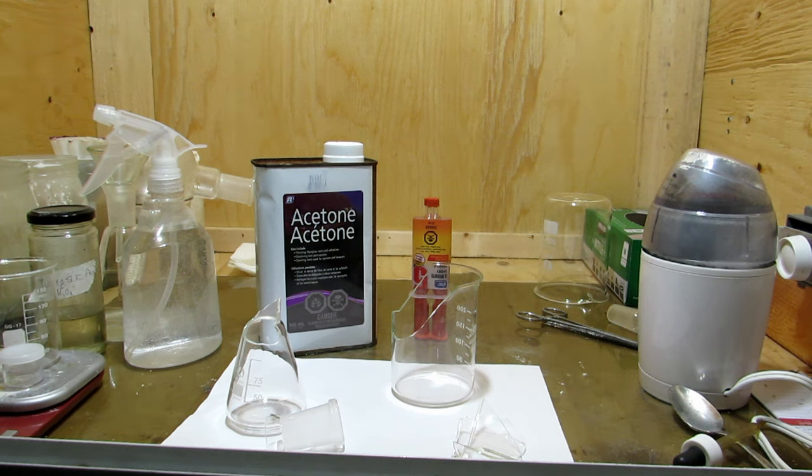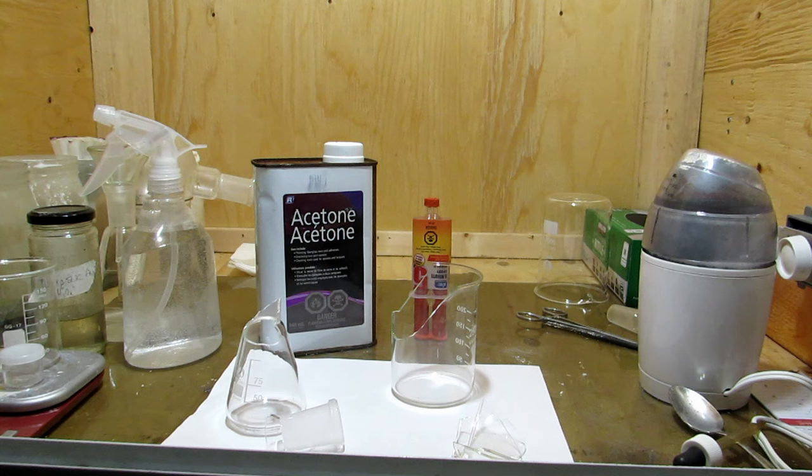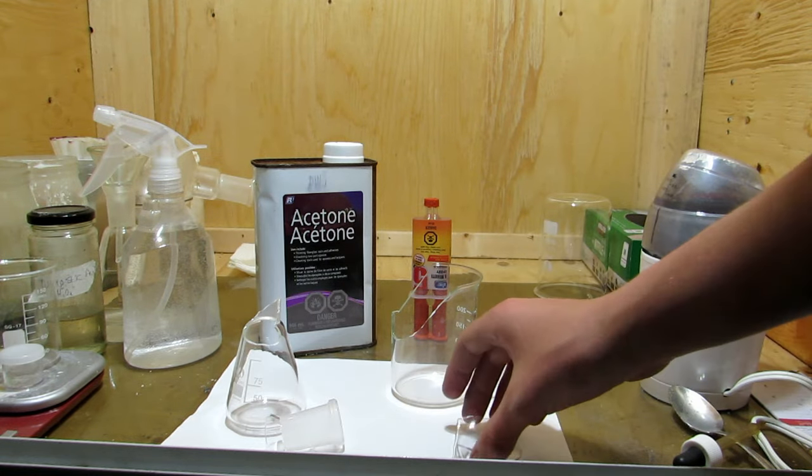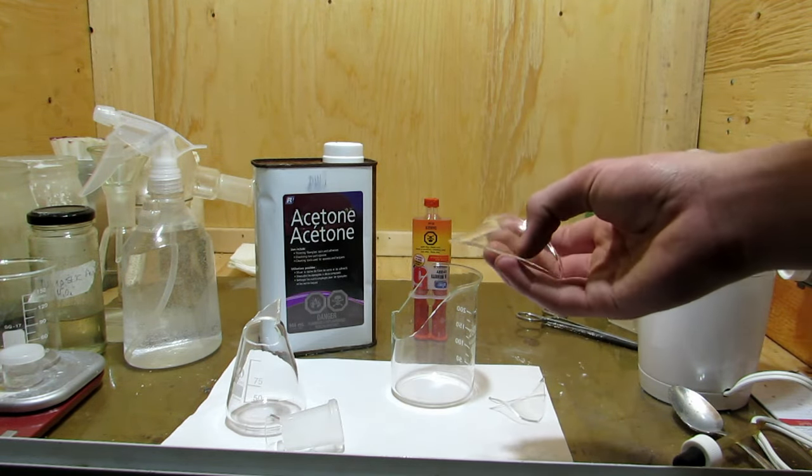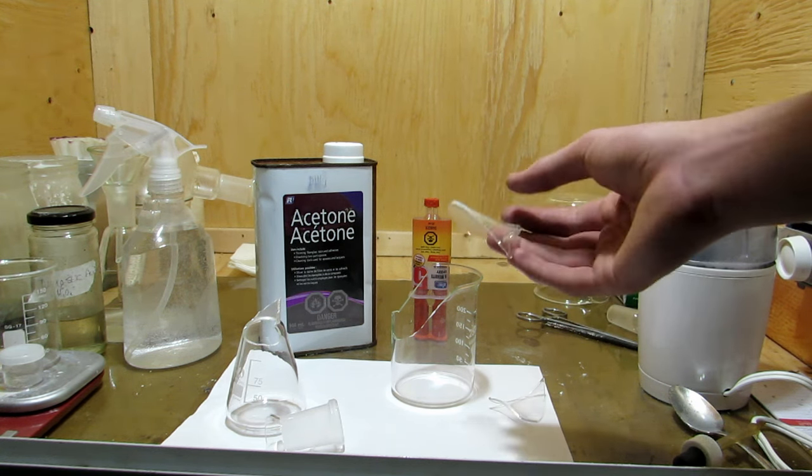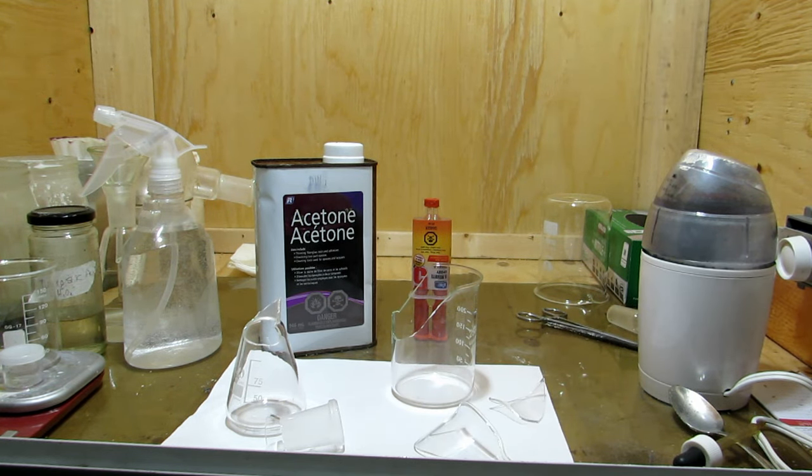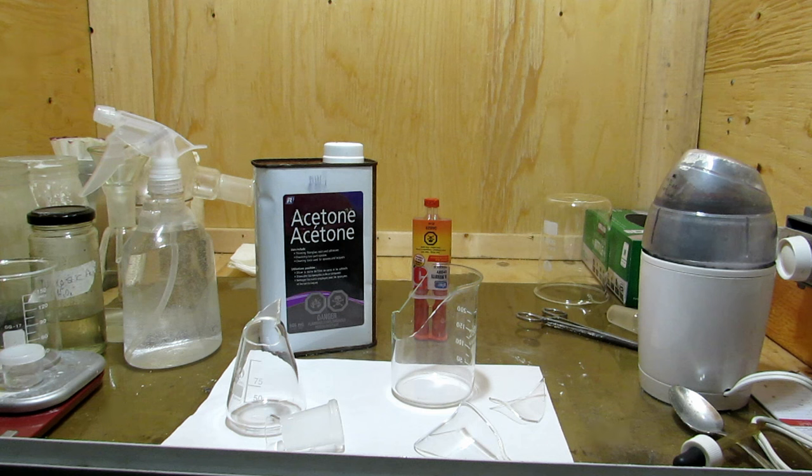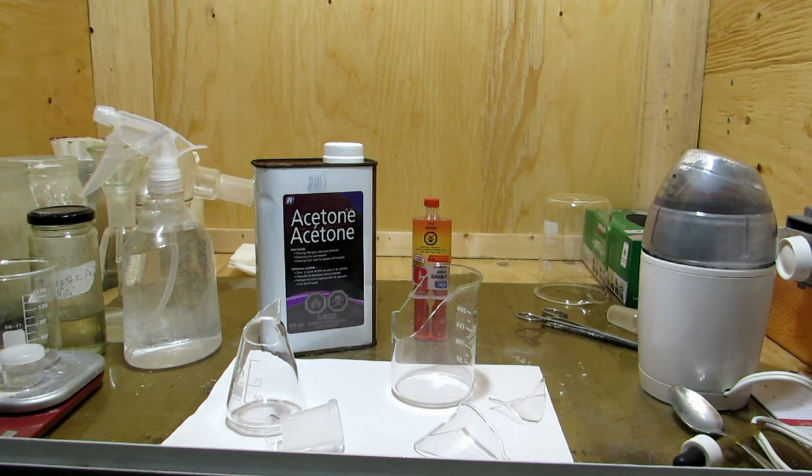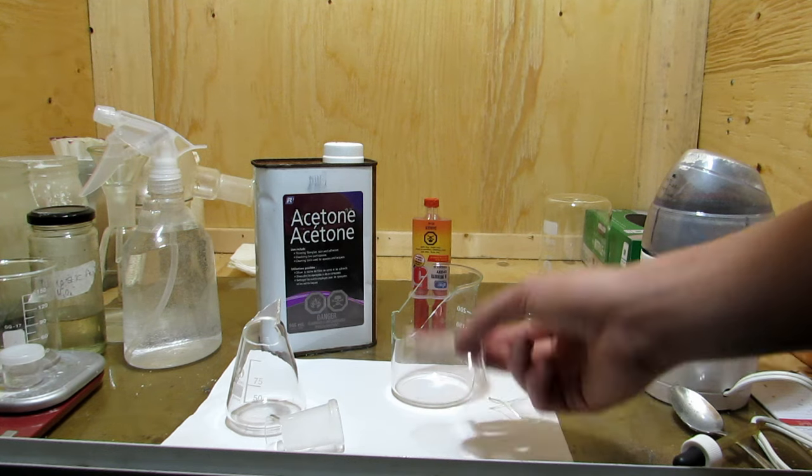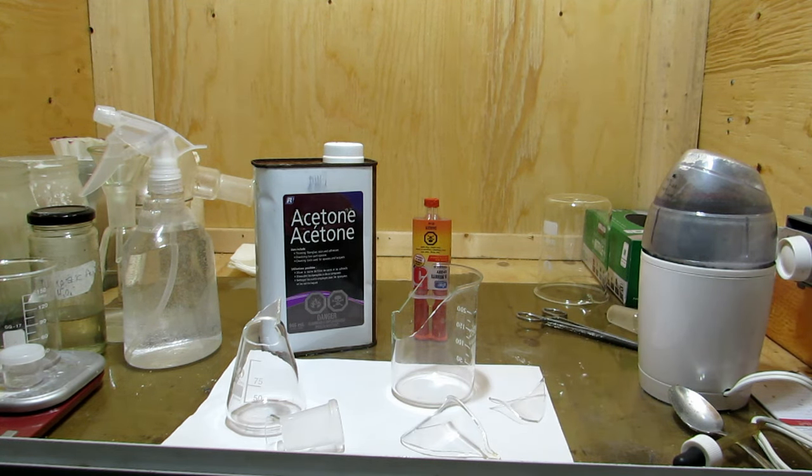What I find much more effective, and still allows the use of the glass as long as you don't heat it too hot, is to actually epoxy it back together. This is what I've done with a couple of different pieces of glassware, and you can actually end up with a very clean piece of glass. You can still see the fracture line, but there's no epoxy residue. What we do is line the pieces with epoxy, glue them into place, let them dry, and then take some acetone and wipe away the residual epoxy, because the acetone will actually dissolve the epoxy. This way we're left with a smooth, clean finish on the inside, no epoxy residue on the glass, and it's still totally useful as a beaker or whatever, and can still be used for transferring liquids or doing reactions in them as long as you don't heat them up. This is a way where you can actually recycle your glassware instead of throwing it out.